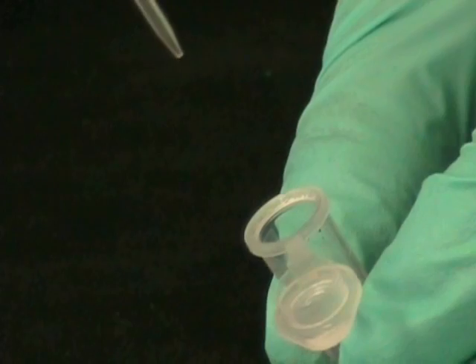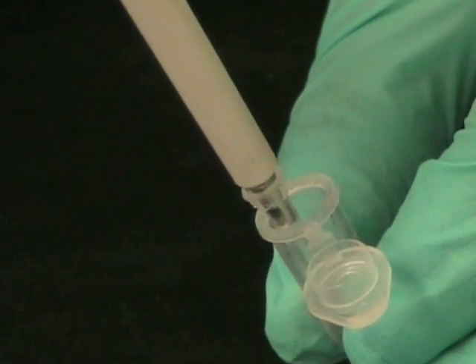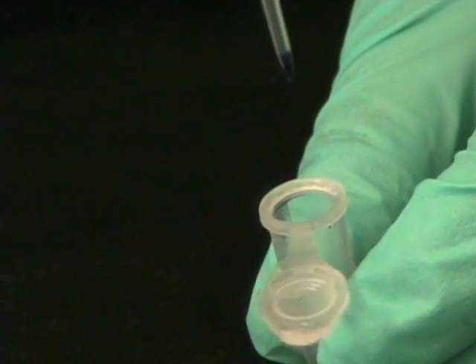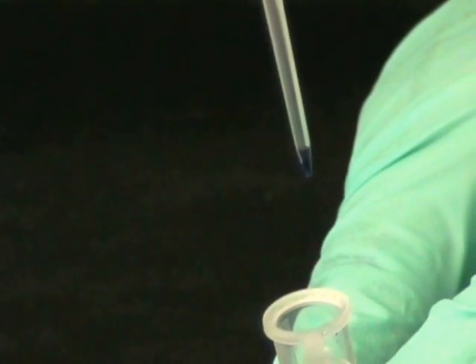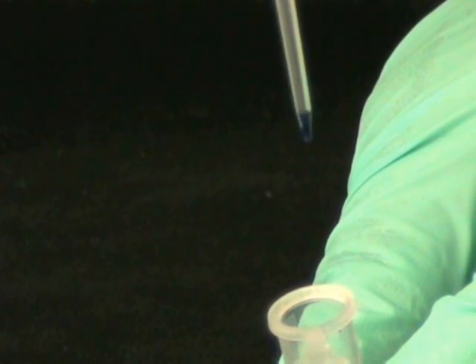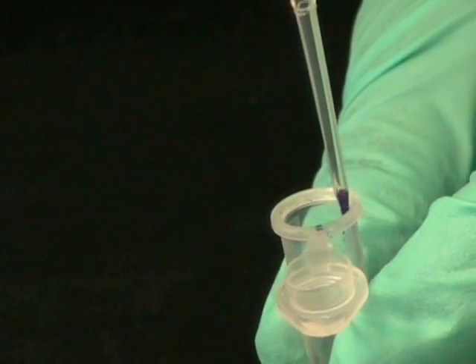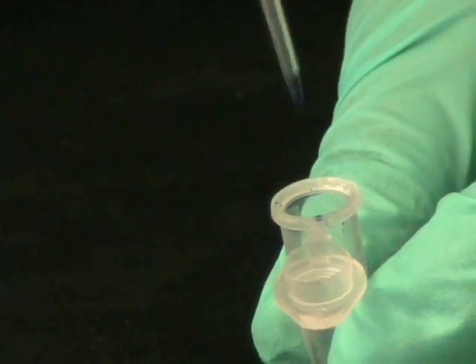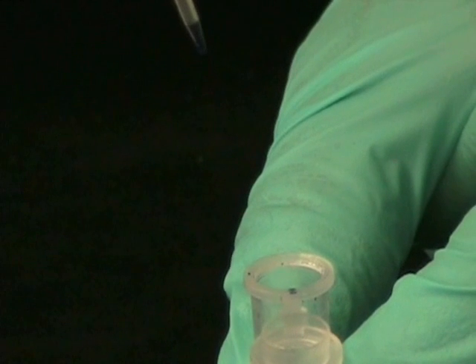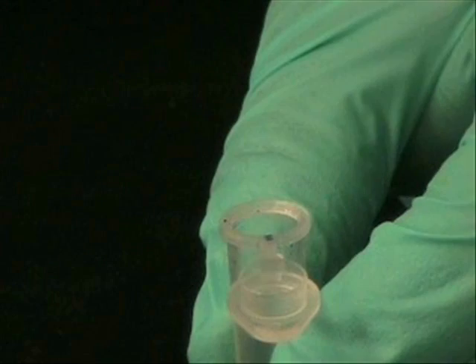Now we're going to look at another common mistake where we transfer more than what you want. I just took up 3 microliters of a sample. We have 3 on the inside and some on the outside. If we don't wipe the tip and transfer to our incubation, we'll be transferring more than what you want. So make sure you wipe the tip in the mouth of the vessel, leaving behind the droplets that were outside. If you forget to wipe the tip, you'll be transferring more than what you want. You won't be creating the ideal environment for your reaction, and there are instances where you will denature the enzyme.